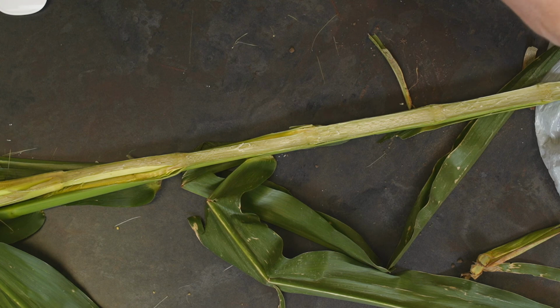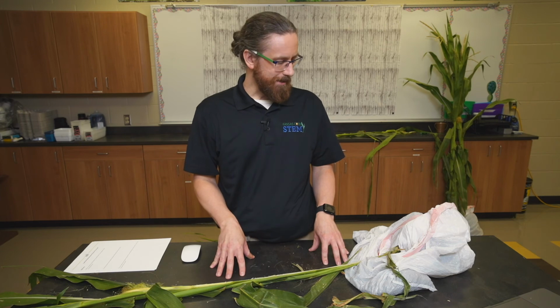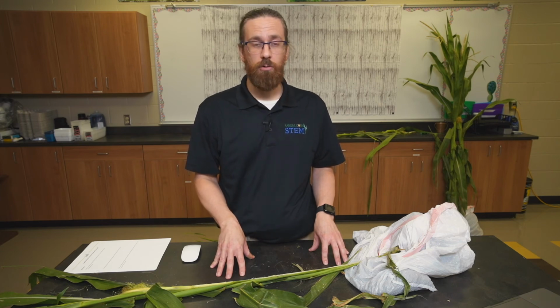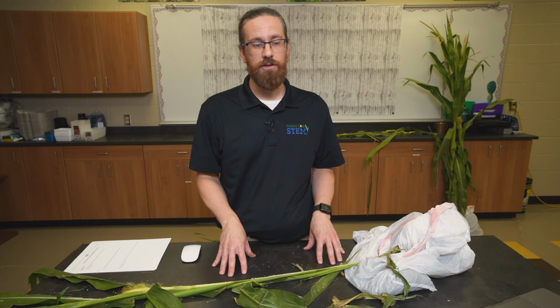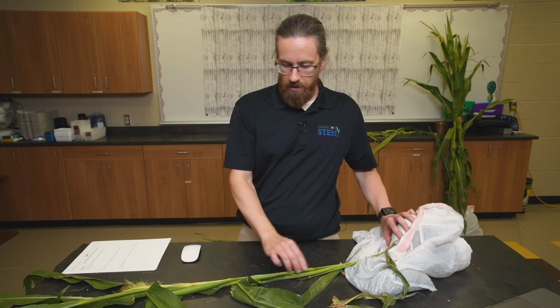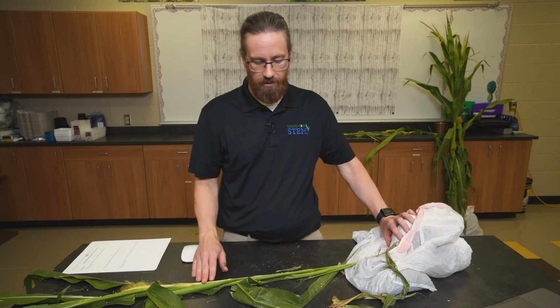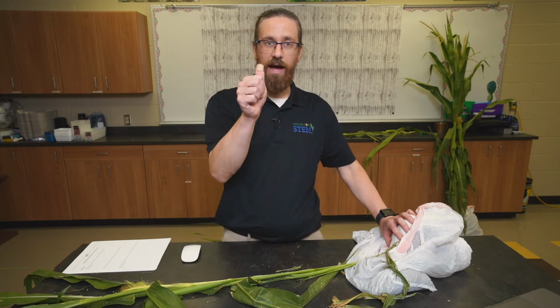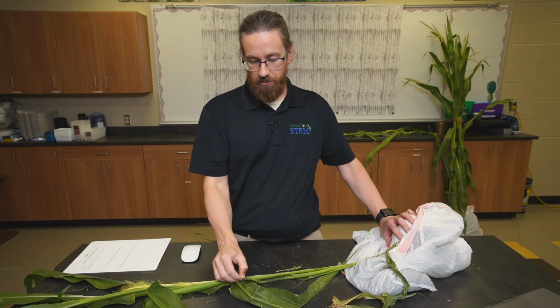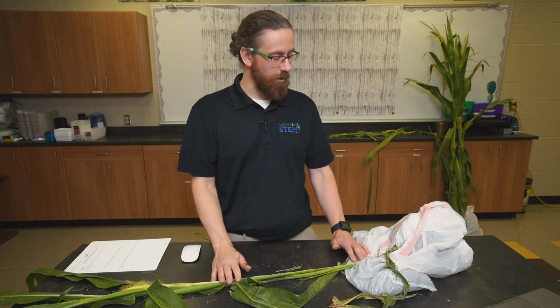Actually, I recommend going from the base of the plant up to the tip or the tassel of the plant if you can. You can use anything available to you, but a razor blade or a utility knife can work really well for this. You really want your students to be careful. Make sure they go slow, and make sure they're stabilizing that corn plant, maybe with other students, so that the student with the utility knife is working their way through. Again, go slow. I was going a little fast, and I wasn't cut by the utility knife, but I probably got a paper cut type of thing from the leaf right here. So do go slow with this.